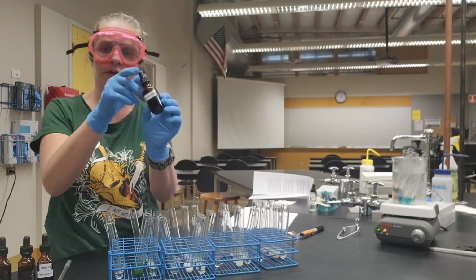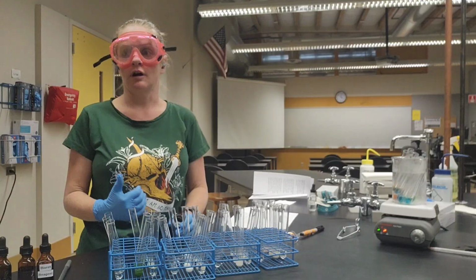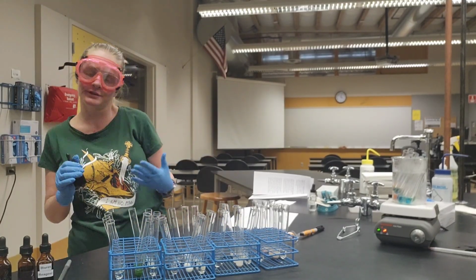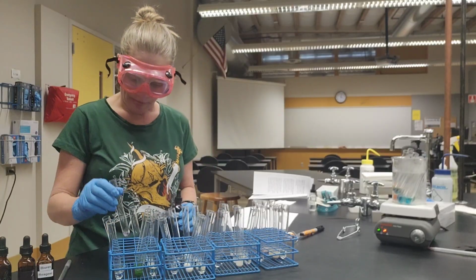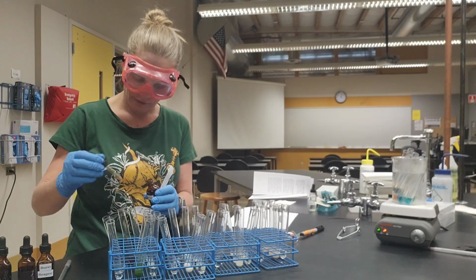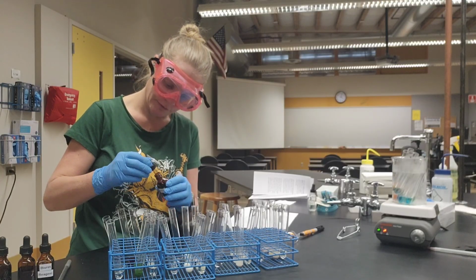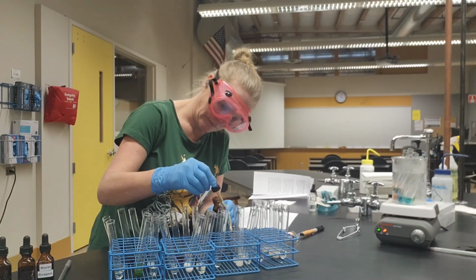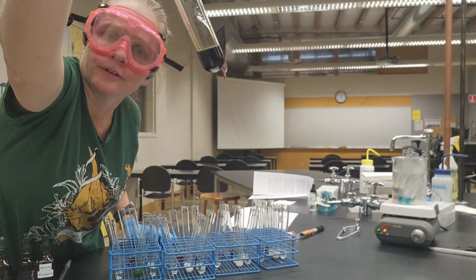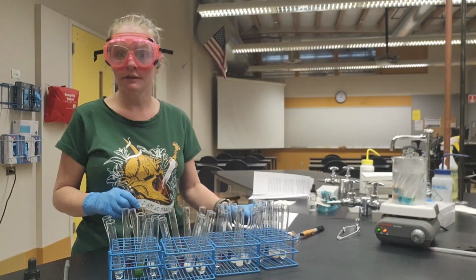We're going to start with our starch next. We're going to be using Gram's iodine as the indicator solution. A positive result is going to cause the liquid to turn black, or sometimes a dark purple or a dark navy blue. But let's go ahead and give that a try. Okay, again, adding 1 dropper full of the solution to each of my starch tubes. Oops. So here's what our positive control looks like. It's pretty dark.